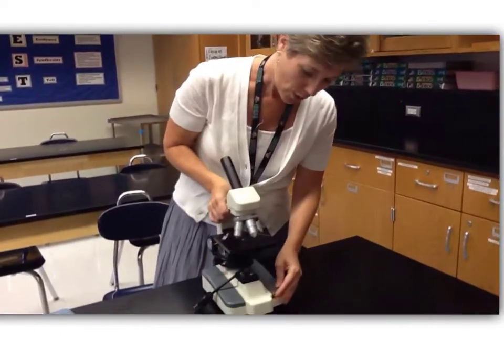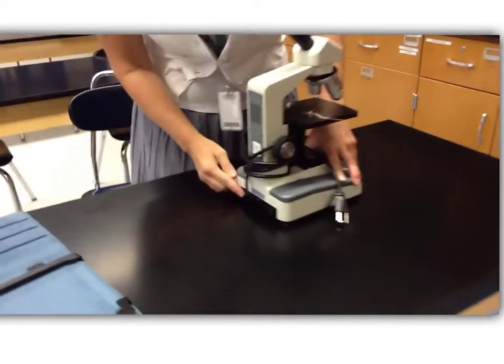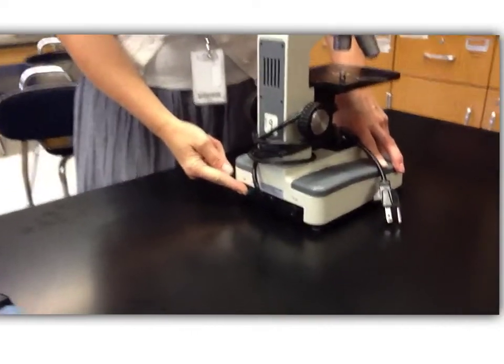Also on our microscope, we have a light source. So before you use your microscope, you're going to turn that on. There's a switch in the back.